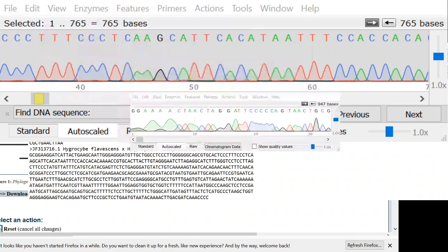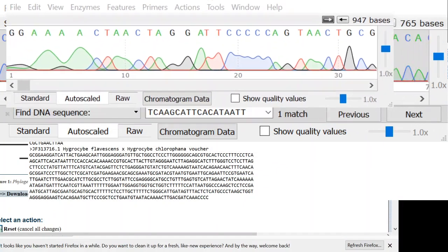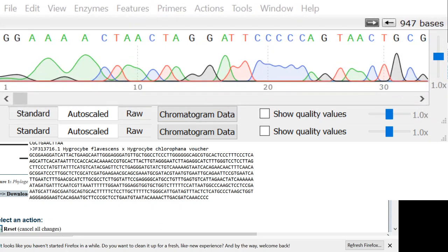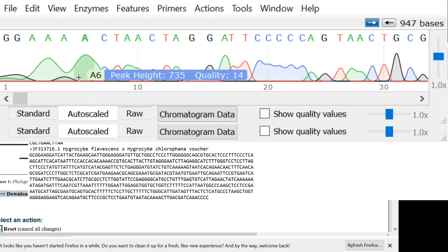Okay, so this other one is another trace I was looking at for someone yesterday. This trace is a gene called the LSU, a large subunit. LSU is cool because it's more conserved. So it's worse for identifying exact species, but it's better if you need to compare sequences from organisms that are not closely related. ITS is very variable, so variable that it's really good for species level resolution, but it's so variable that you cannot compare things in different genera and have decent bootstrap support.